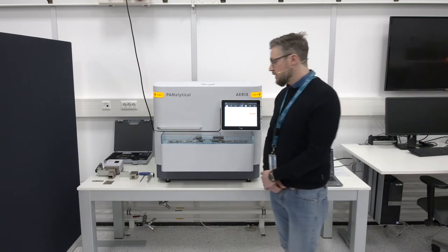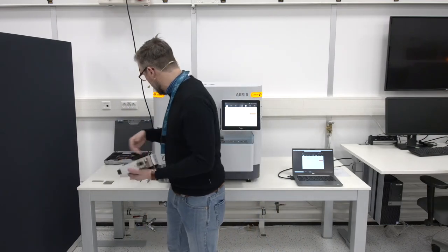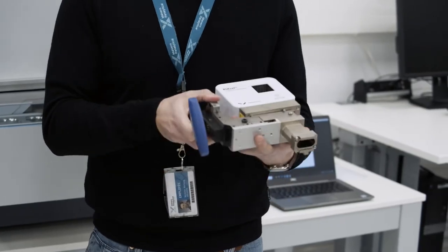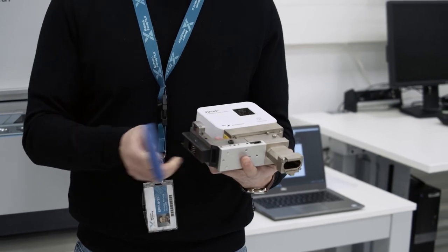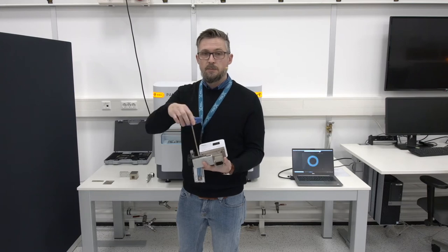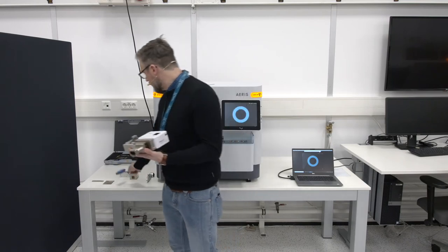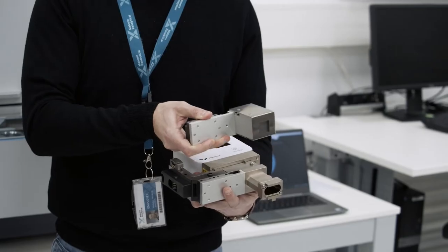We achieved this by introducing a prefix-on-prefix concept on the secondary side, which you can see here. In addition to the normal prefix used to mount the whole optical beam path onto the goniometer, we introduced a second prefix with which you can mount and dismount the optical component in front of the detector. In this case it is a fixed anti-scatter slit, and for a grazing incidence measurement you would switch to a parallel plate collimator.